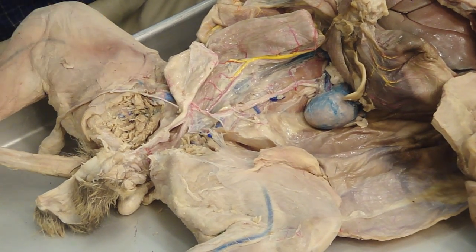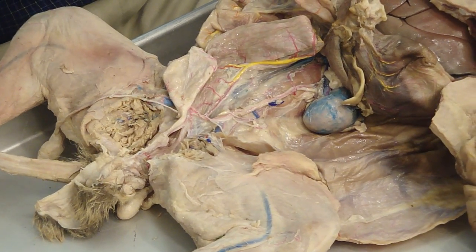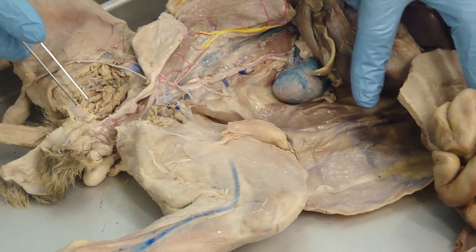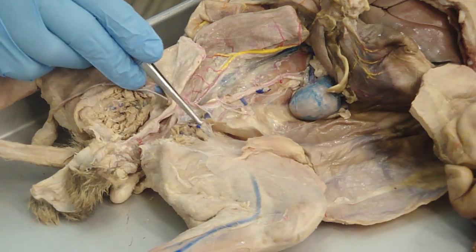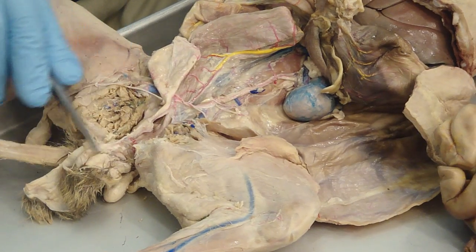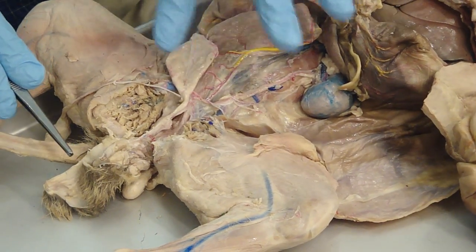So that's number one. Number two, remember that this animal, this cat, was very, very small. So the distance moved is very small. It didn't have to go from here to here, right? Number three, the gubernaculum came out here and attaches to the scrotal swelling. As the scrotal swelling outpockets, it probably pulls to some extent on the gubernaculum. So that happens as well as its shortening.